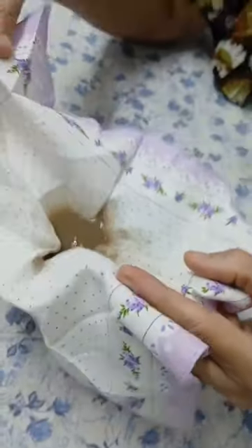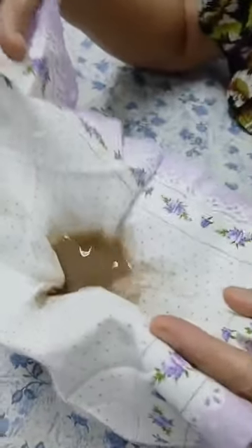So the cloth is also able to filter, but this is not the pure filtrate. This is just the explanation that the porous cloth is being used to filter, and the insoluble mud particles settling on the handkerchief are known as the residue. Now you can see, this is the residue.